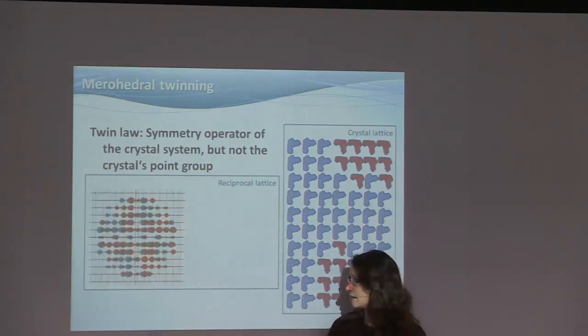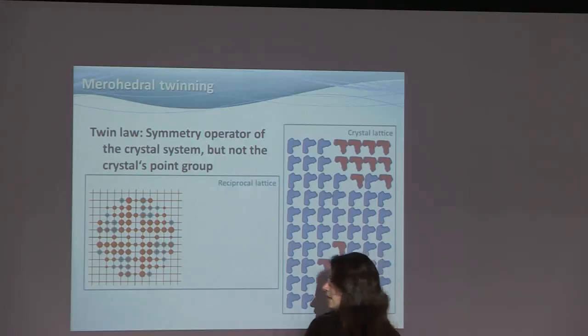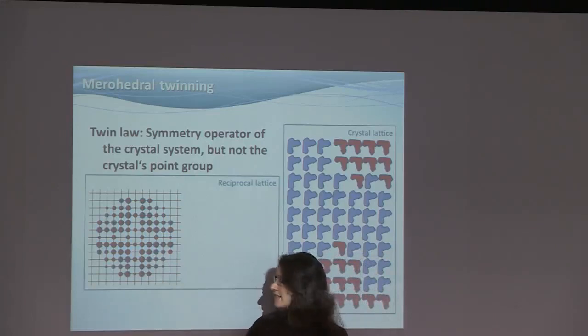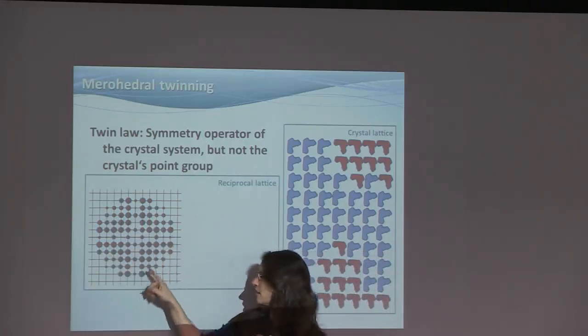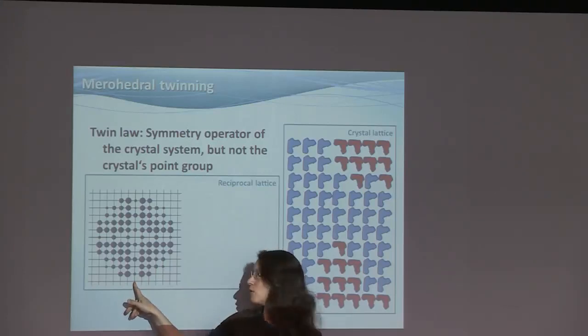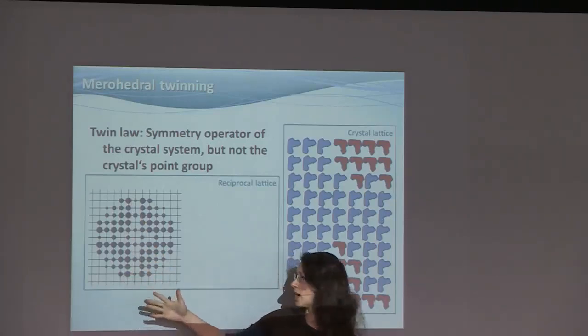Now, if we overlay them, the result still has that fourfold symmetry, but it has higher symmetry now than it had before. We've now gained, depending on how you look at it, twofold rotation here or a mirror plane. In 2D, you can't tell.